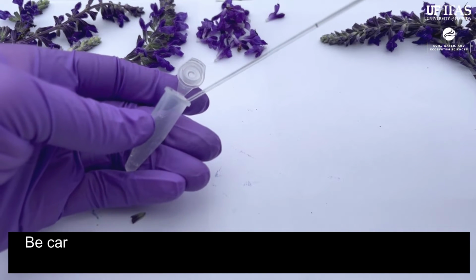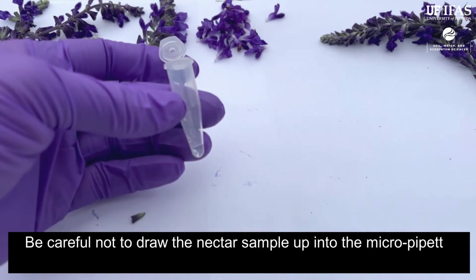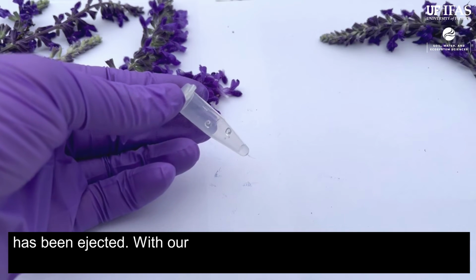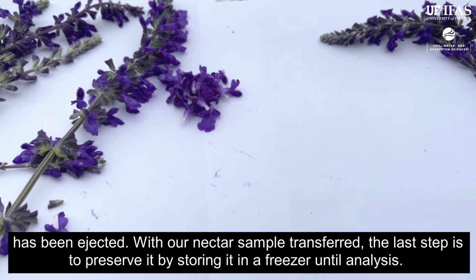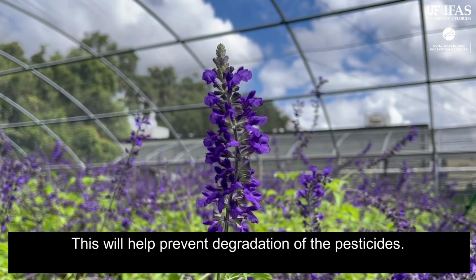Be careful not to draw the nectar sample up into the micropipette valve by applying continuous pressure on the valve until the nectar has been ejected. With our nectar sample transferred, the last step is to preserve it by storing it in a freezer until analysis. This will help prevent degradation of the pesticides.